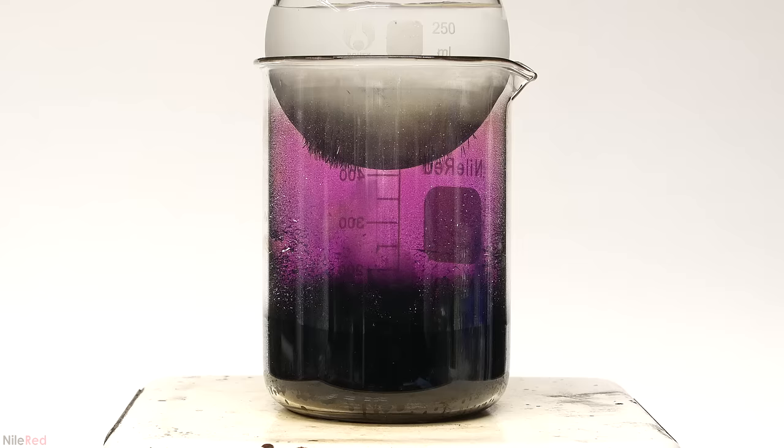Because of this, the vapor condenses back into liquid iodine, and doesn't immediately solidify. Then, it drips back down, and gets revaporized.